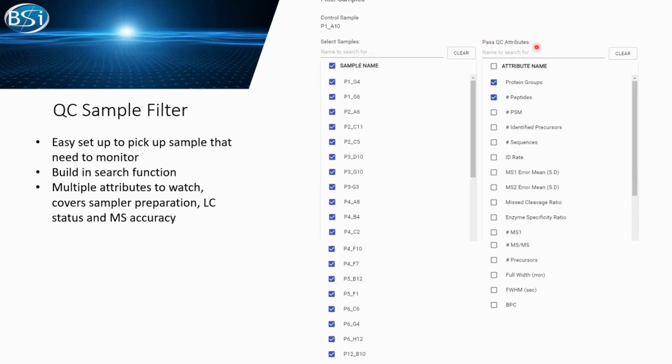On the QC attributes, you can select any attribute that you would like to monitor. In general, in proteomics, people are more interested in the identified protein groups and peptides. So here, we also select these to monitor our samples and see how they are behaving.